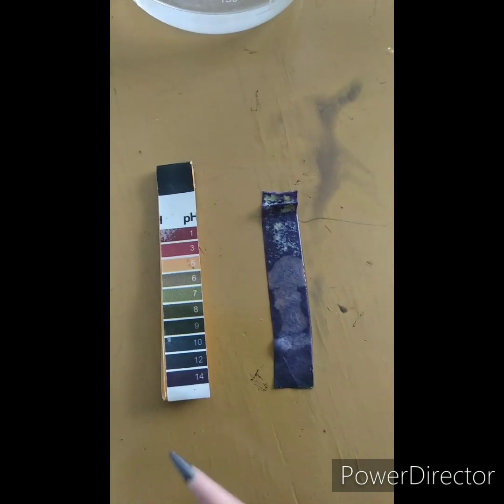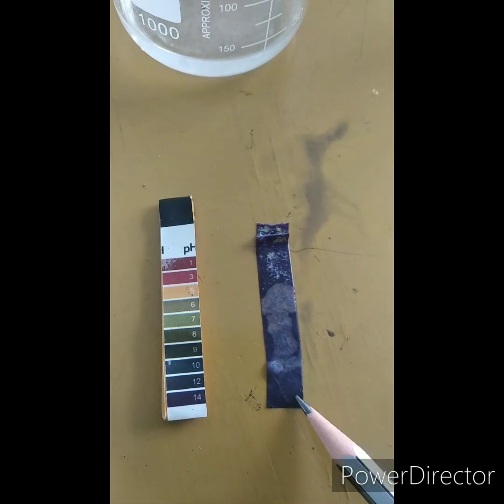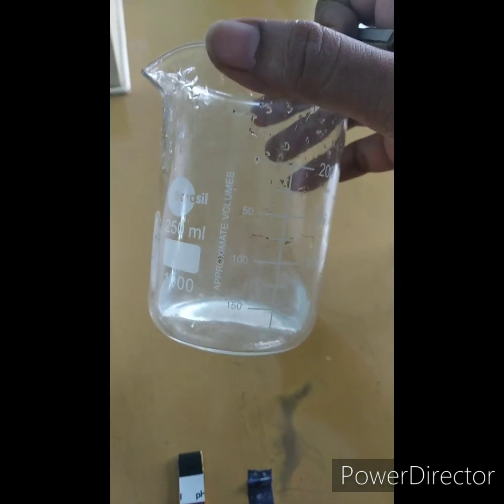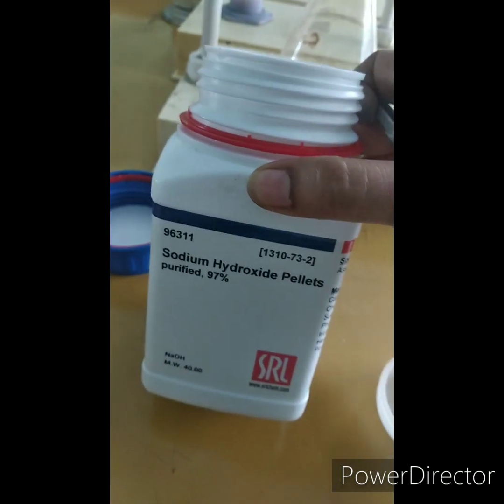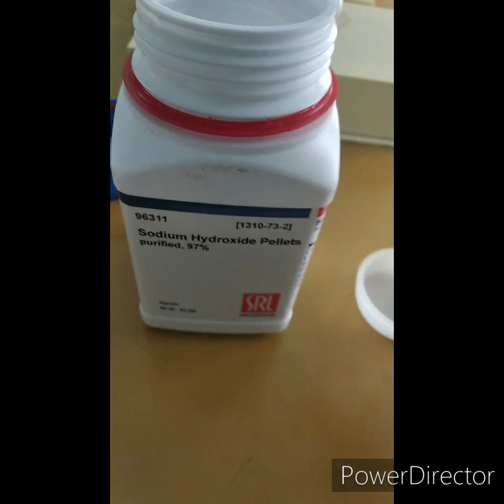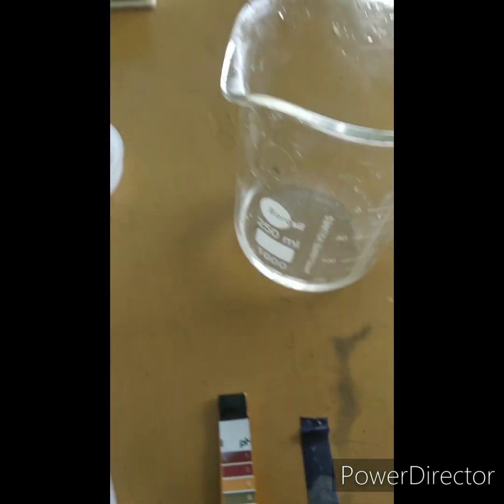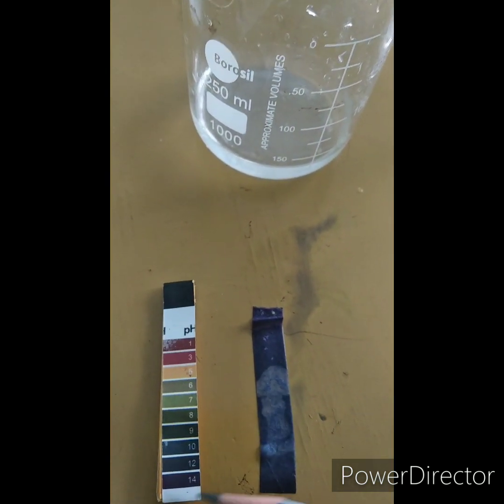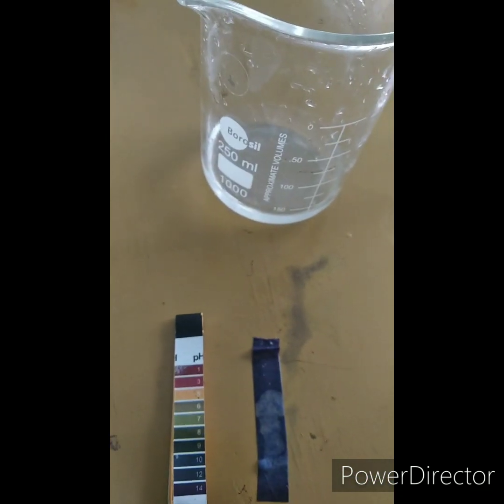It reads 14 — highly alkaline. Can you see? Students, this is the sodium hydroxide solution, completely solubilized. Since it is basic in nature, its color got completely changed to 14, which is higher than 7. As we know, above 7 is basic in nature.